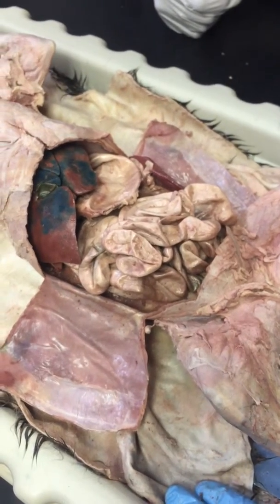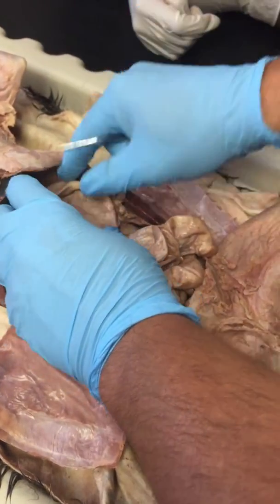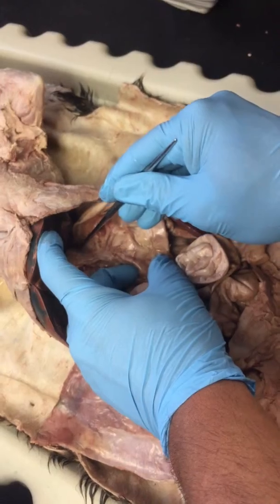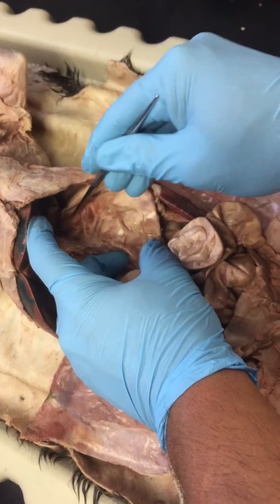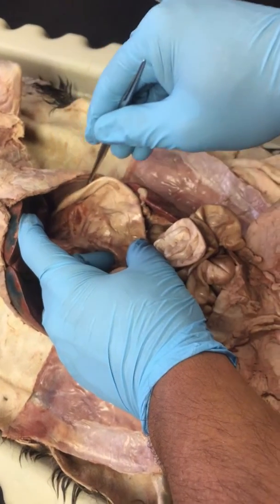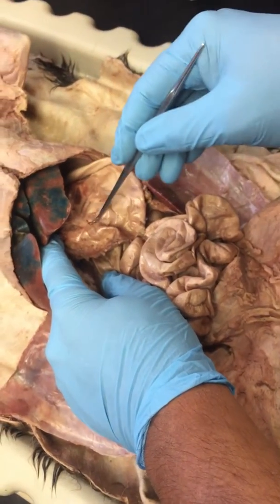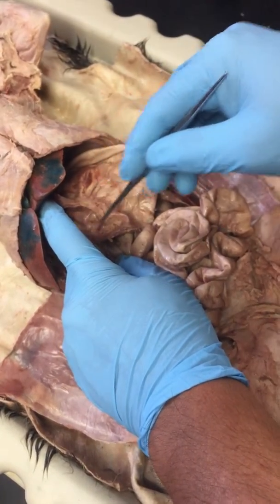Okay, now as far as the organs are concerned, we have our stomach right here, which we learned about yesterday, but I wanted to point out the three sections of the stomach. The esophagus comes into the stomach right here. Okay, this is the entrance of the esophagus right down here. And so this is the cardiac portion of the stomach. This dome-shaped part of the stomach over here that kind of comes laterally, that is called the fundus or fundic region. And then the end of the stomach right here where it goes into the small intestine, that is called the pylorus or pyloric region. Okay, so we've got the three regions, the cardiac, the fundic, and the pyloric regions.